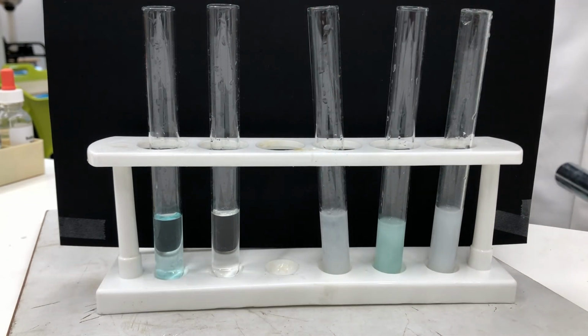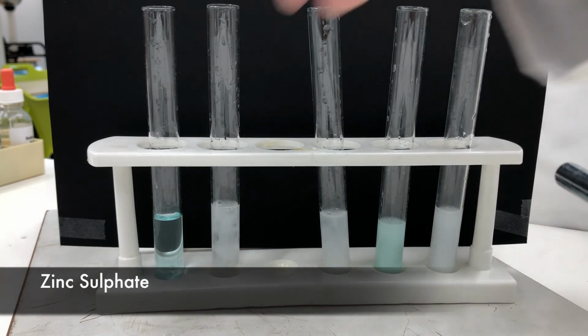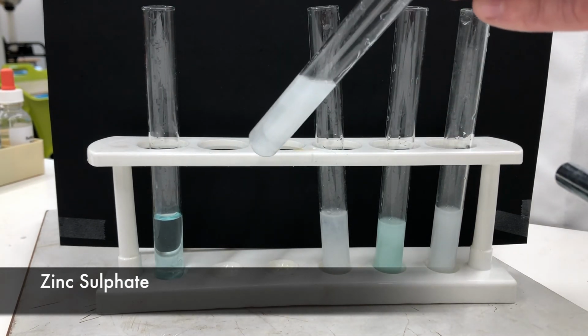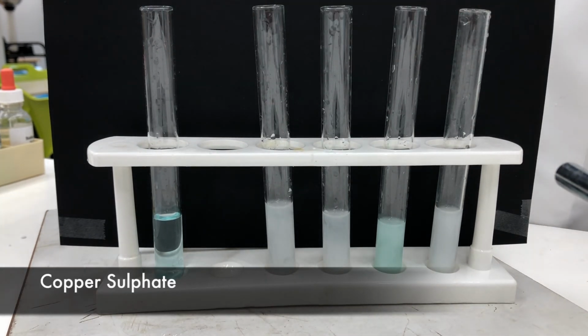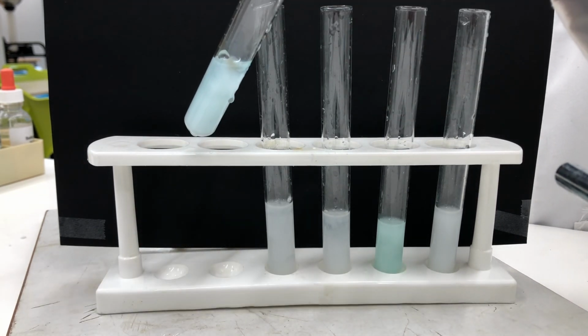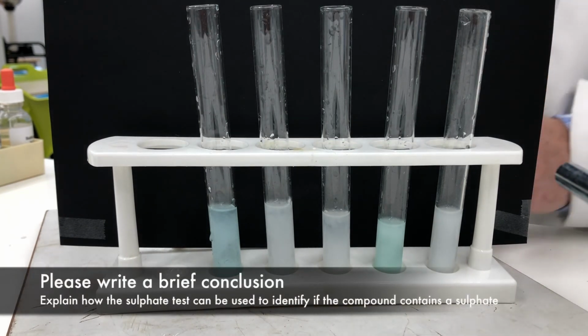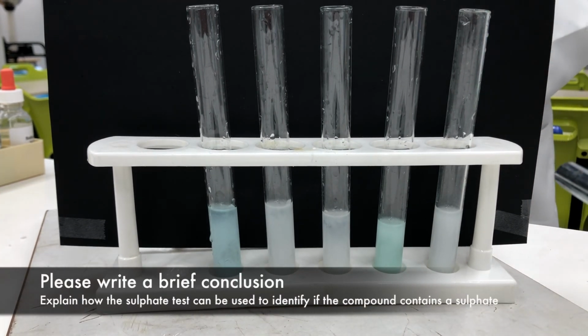2 more, zinc sulfate. Once again, we get a white precipitate. And our final one is copper sulfate. Copper's got that very characteristic blue color to it. And we get a white precipitate forming with our copper sulfate. So each of those are sulfates. So we expect a white precipitate because sulfates precipitate out to be white when we add barium chloride.